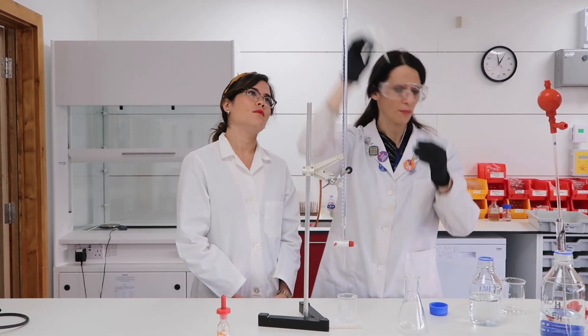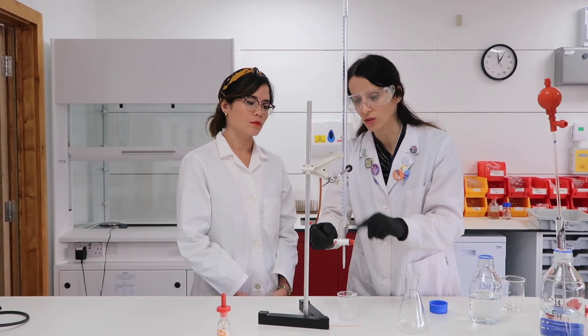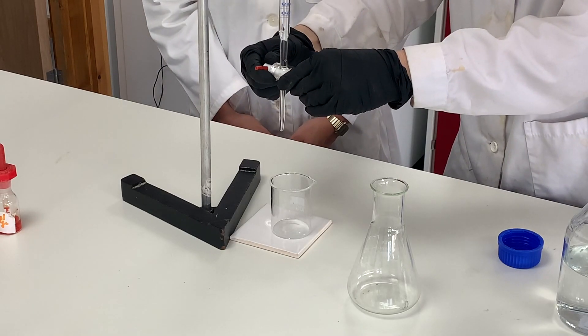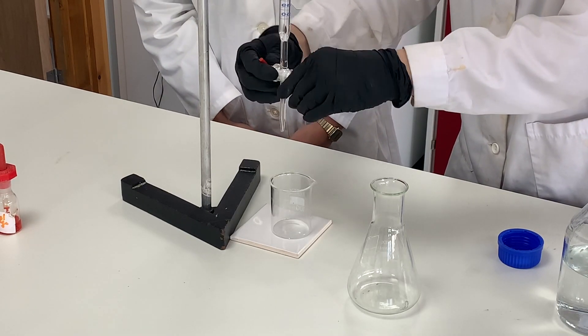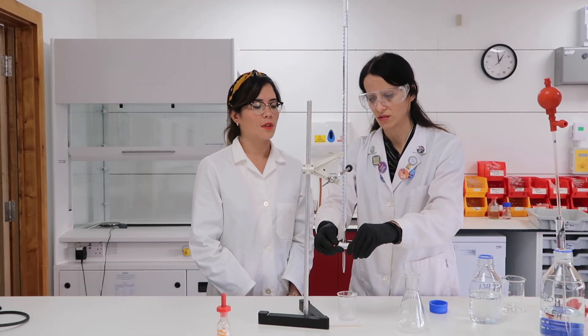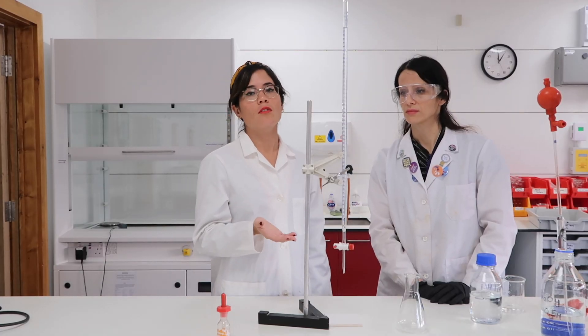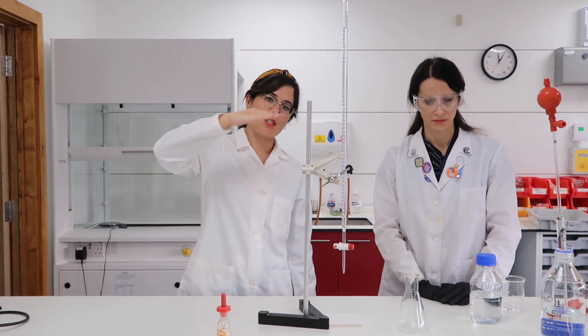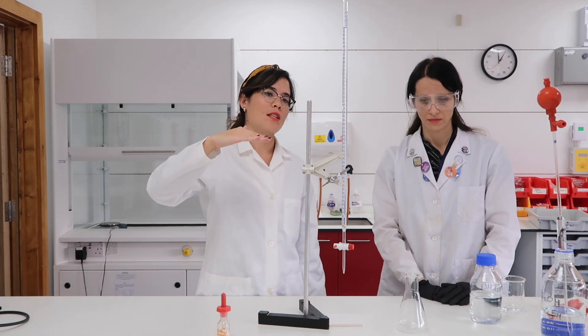Because I want to start from zero, I'm going to lose a bit of acid into the beaker and also to get rid of any bubbles that sometimes form at the top. In order to avoid parallax errors, you need to make sure you read from the bottom of the meniscus, because if you look at liquid in a particularly narrow tube, you notice it has a very curved shape. So you need to read from the bottom of what's known as the meniscus.